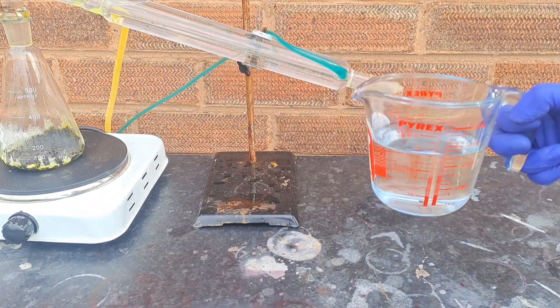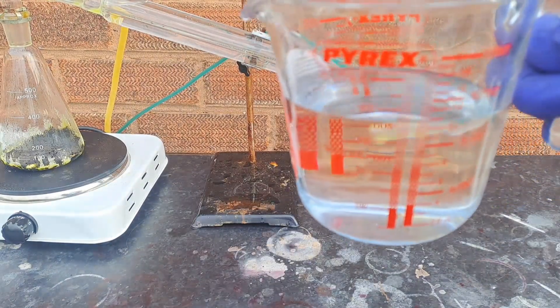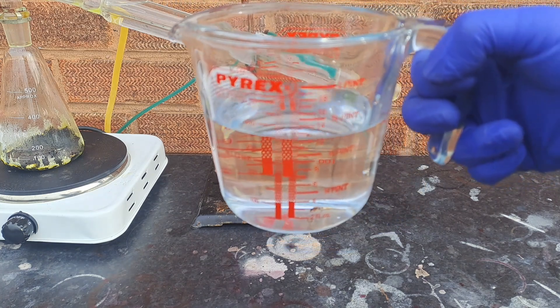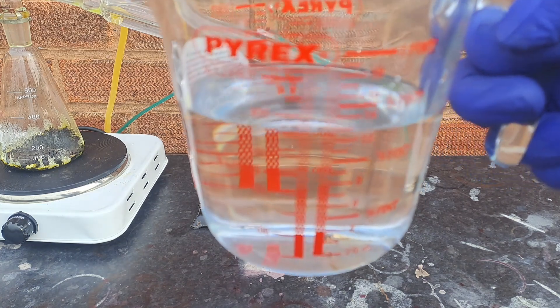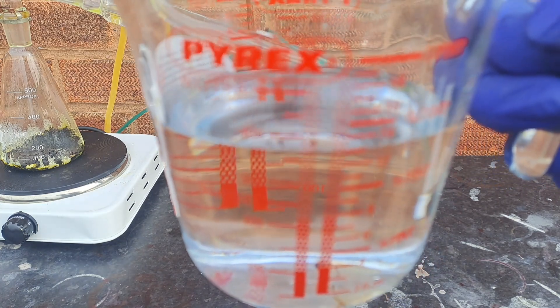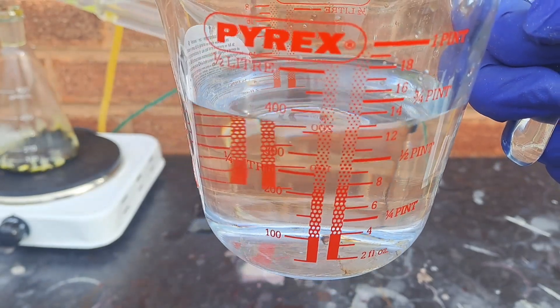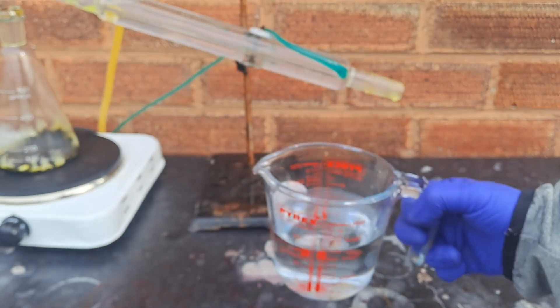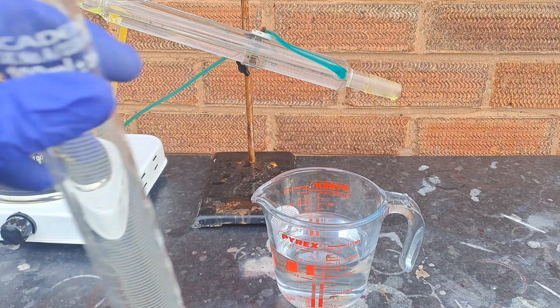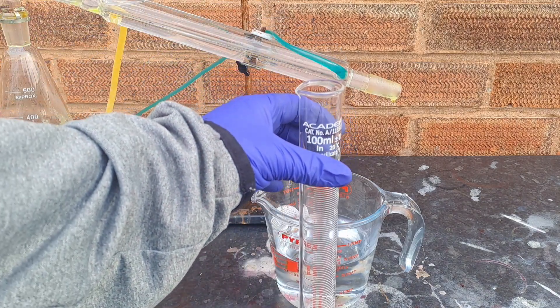And there you have it. The copper chloride residue is left in the boiling flask, and I have recovered 400 milliliters of hydrochloric acid. The next thing to do is to see how dilute this acid actually is.